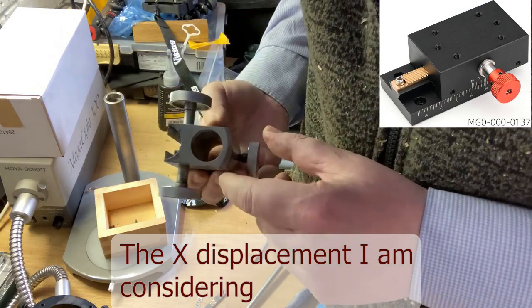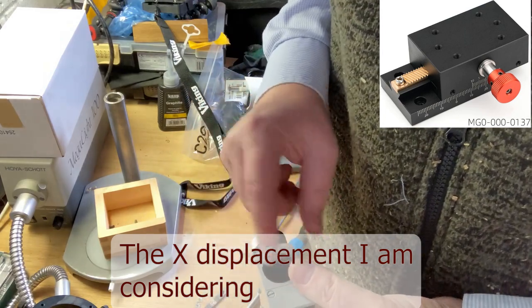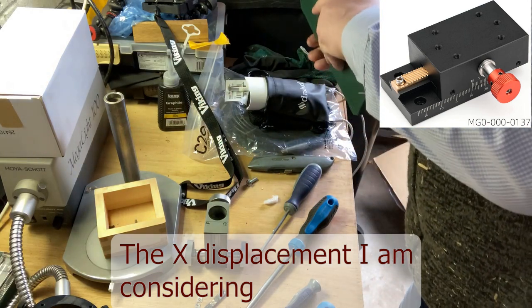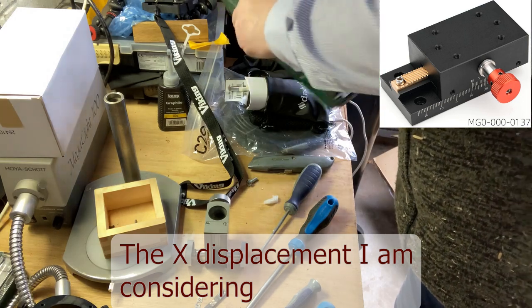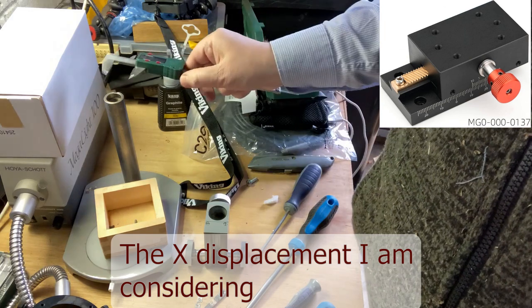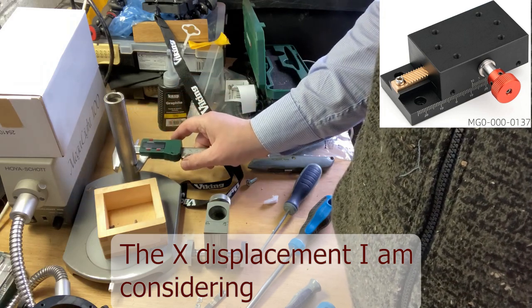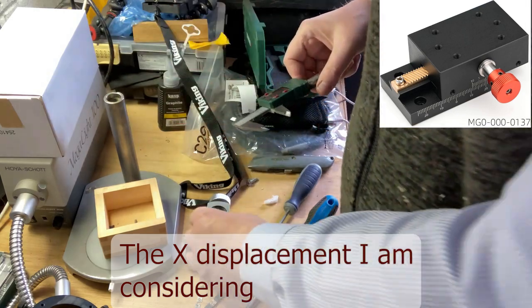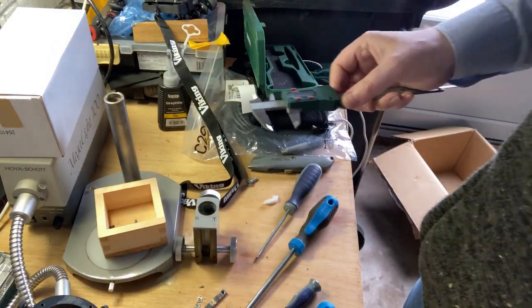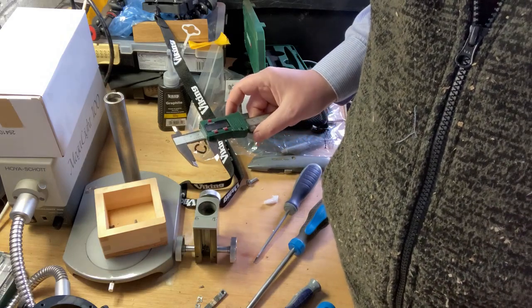So I need to create something to attach the displacement onto, which will be that bore, and I will quickly check what that bore is just now. It's going to either be metric or imperial, so is it going to be an inch? That's got 24.6 on this, 24.5. So I'm assuming that I want it to be 24.5. So it's just under the inch. So I could get away with making it an inch in size, just to make it easier to move it up and down.